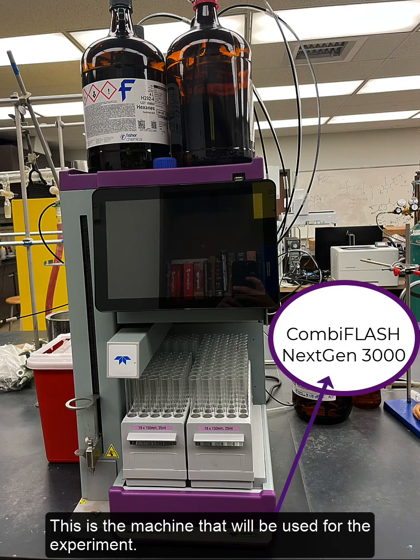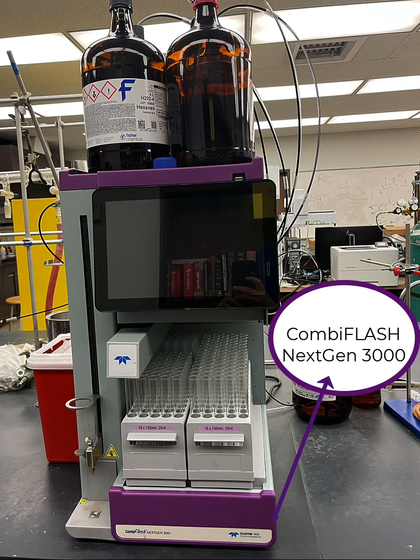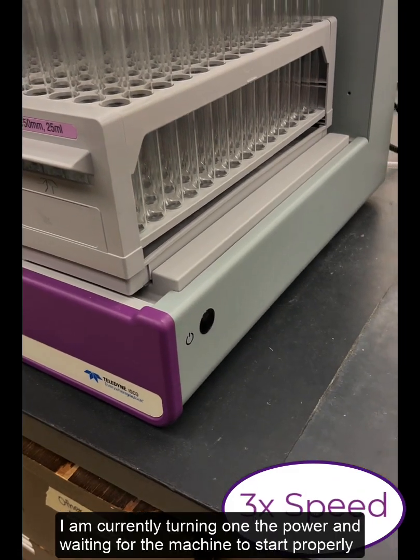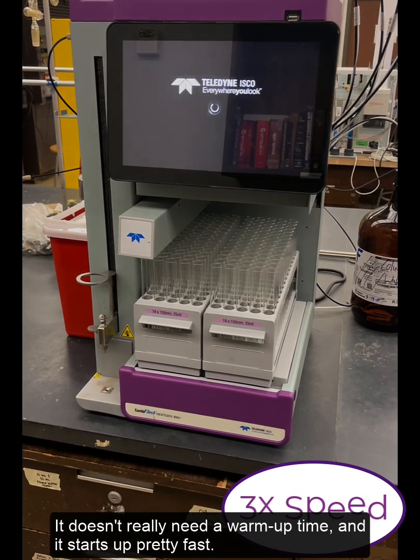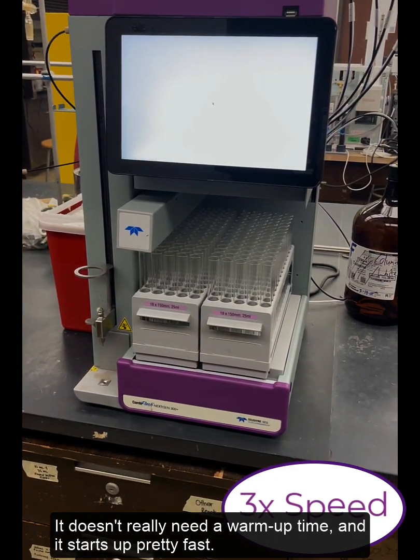This will be the machine we'll be using for the experiment. I'm currently turning on the power and waiting for the machine to start properly. It doesn't really need a warm-up time and actually starts up pretty fast.